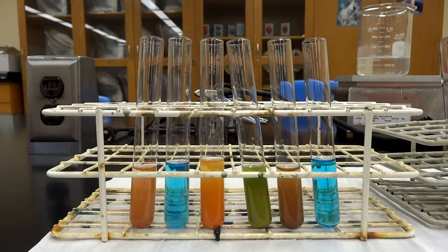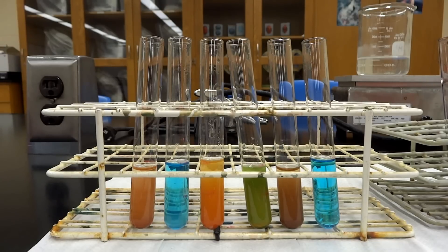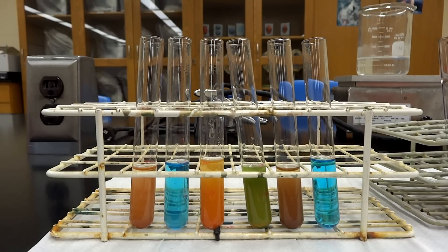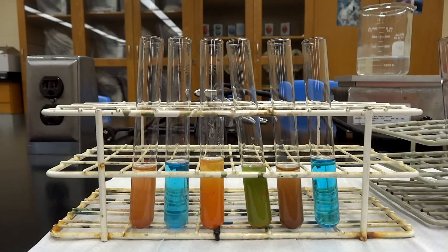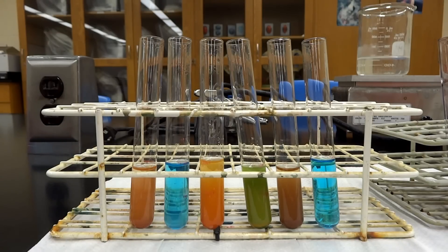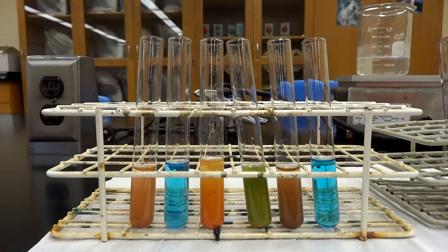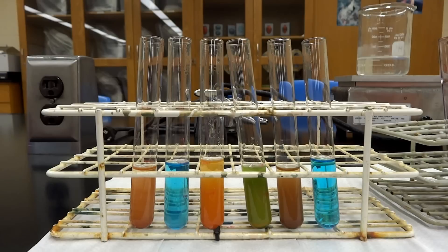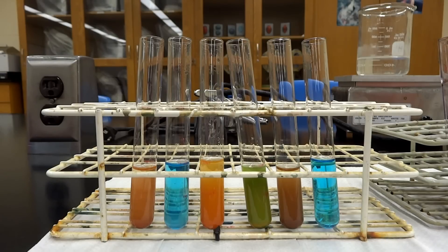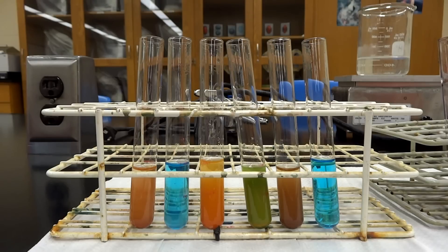We're looking at test tubes — they are pretty colored, and this is what you get to do for lab number four. We've set up some examples of the very best results to run through what you should see and why you're seeing it with each experiment. We're starting with 4.1 from lab 4, which is testing for reducing sugars using a Benedict solution.